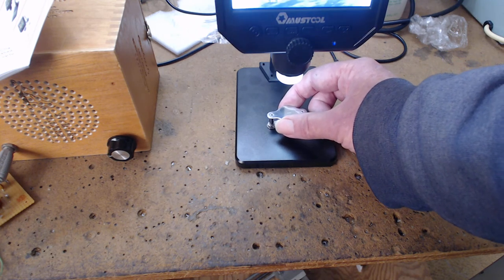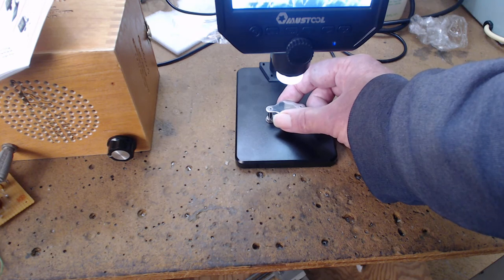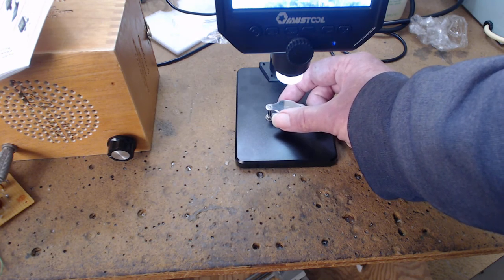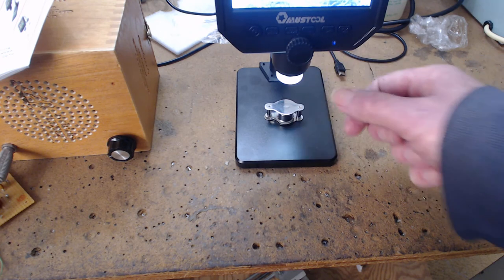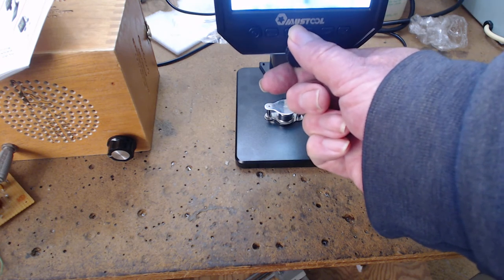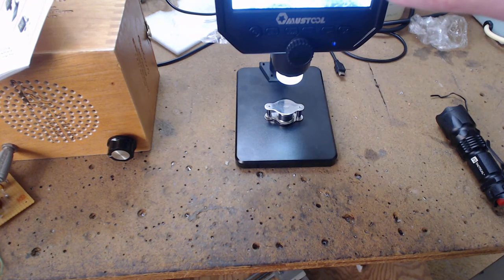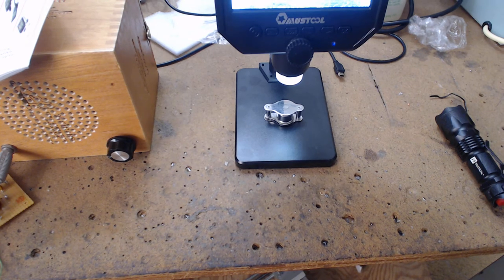This is going to take a while to get used to. You know, I used to work under a microscope. That's the other thing. This has so much magnification. And notice how flimsy this is. That's why you want the aluminum one, if you can get it. And I guarantee you, that's got some type of problem. Oh, it's not even in the frame.